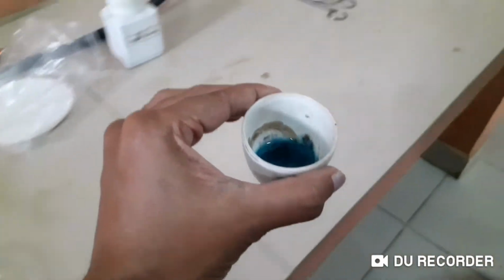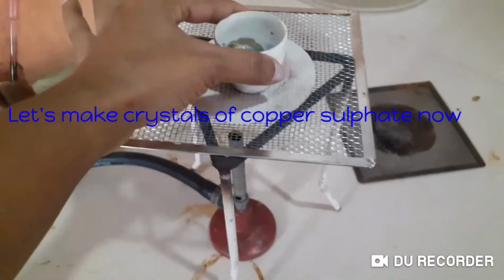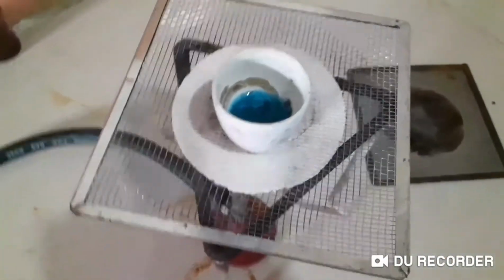Okay, we emptied that. You can see there's a blue color solution, right? Okay, that's in the crucible. Oh yeah, you can keep it back again. And we are going to heat this. Okay, right, we have to light this up.